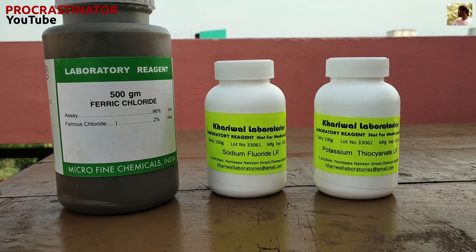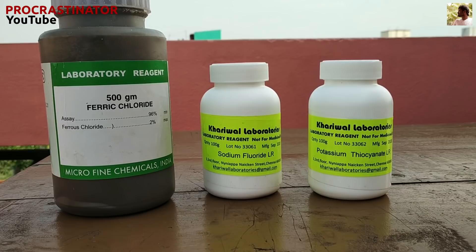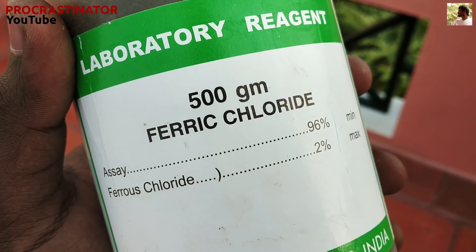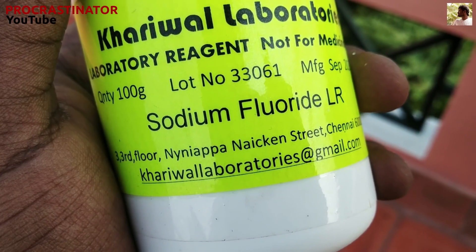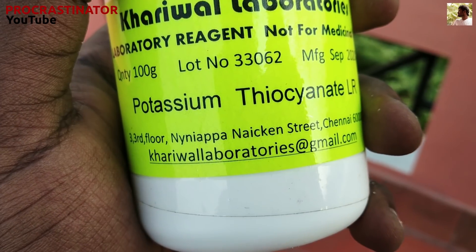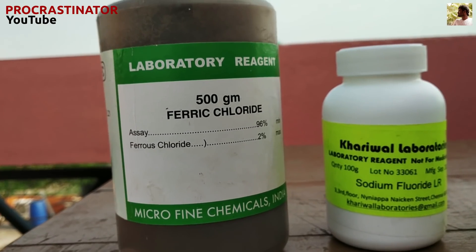In this video, we will use 3 chemicals: ferric chloride, sodium fluoride, and potassium thiocyanate. So let's work with these 3 chemicals.